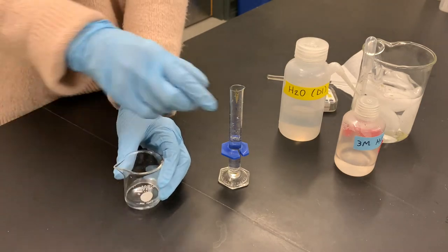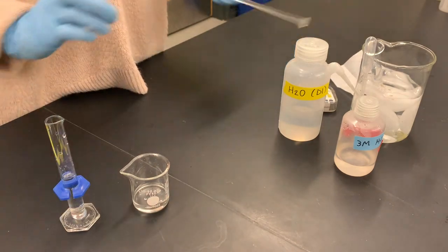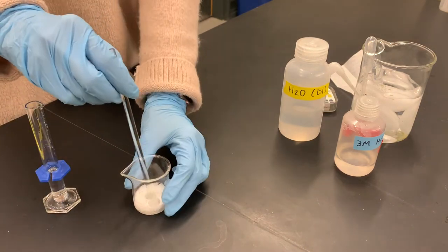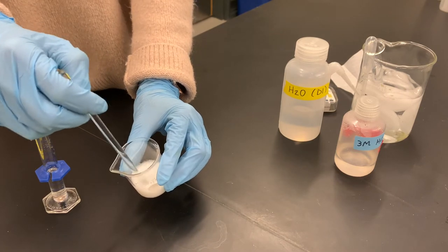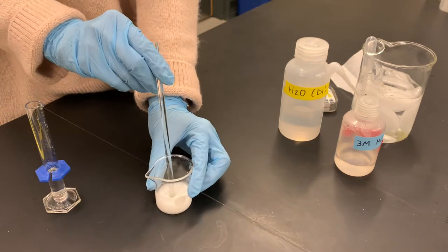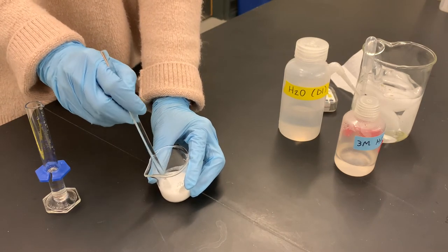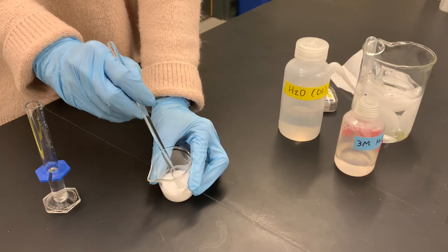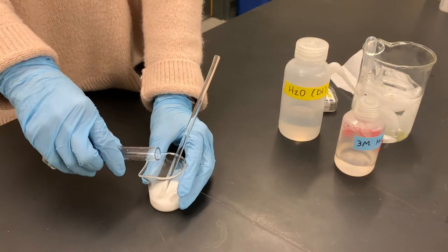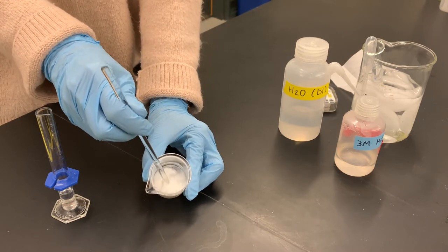It's totally okay if we make it extra acidic. I'm going to begin by just putting a little bit in — we don't want to add too much at once. And you can see that worked really rapidly. Since you're not touching this, you probably can't tell the texture, but it's pretty thick and chunky. I'm going to put in a little bit more. Look at those chunks right there — look at how thick it's getting.